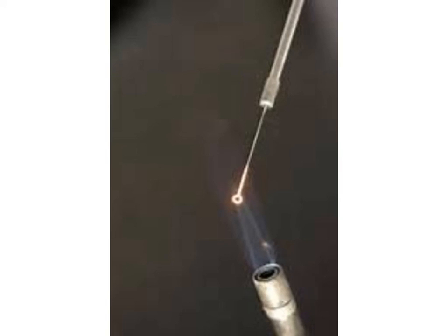The first step in streaking a plate is to take our flame loop and hold it over a flame until the end of the loop is nice and red. We're sterilizing the loop, making sure that there are no bacteria on the loop.